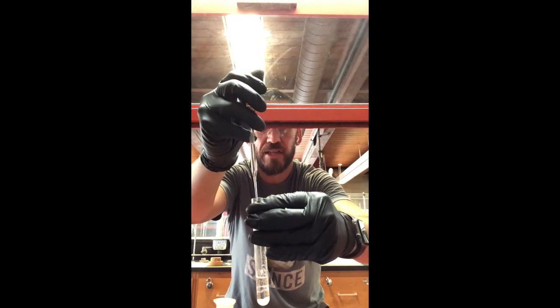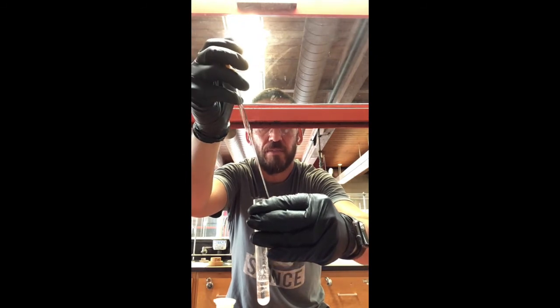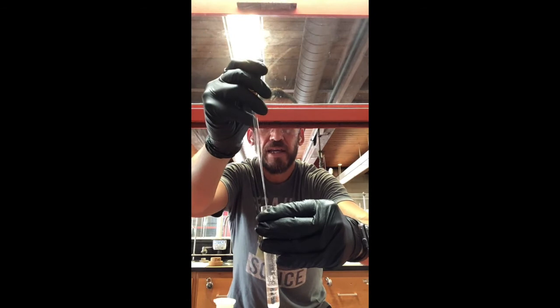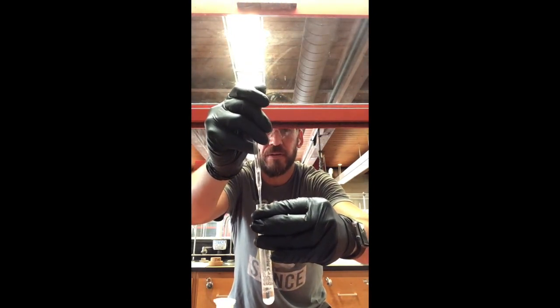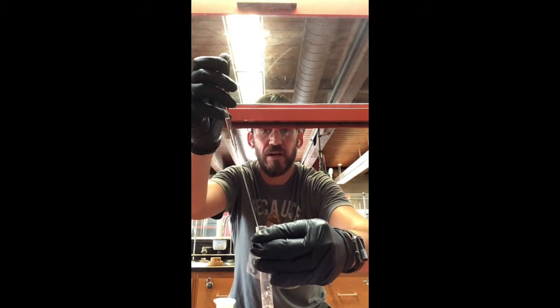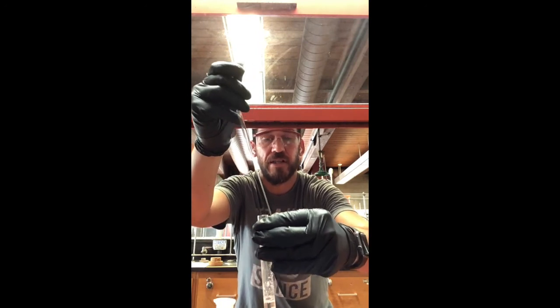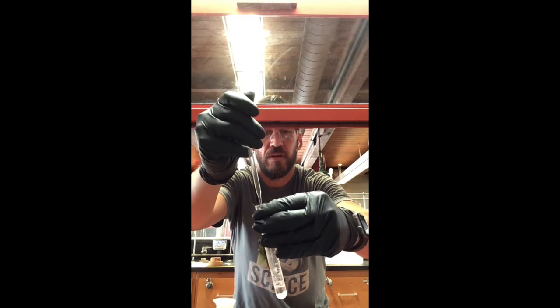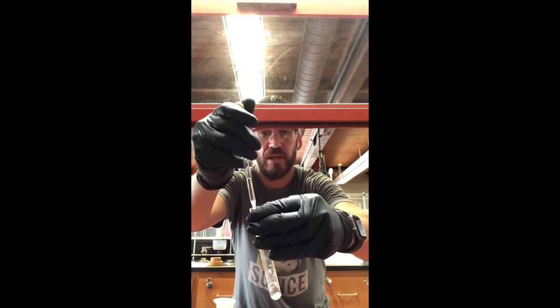So what I was saying is that it's really important to leave the solid material behind, because we don't want that to be calculated in our mass of caffeine that we've extracted. So if it's necessary, we can technically filter it, but right now I think we can be really careful and not take any sodium sulfate.